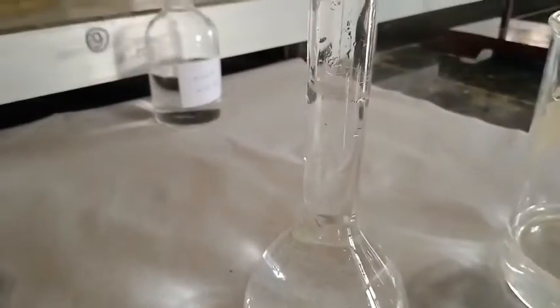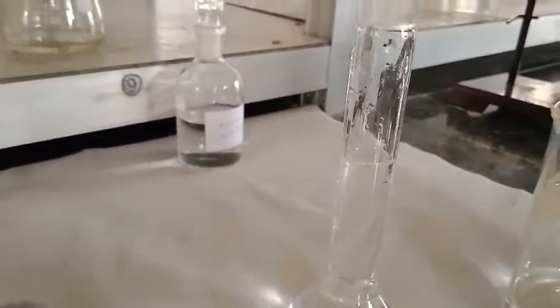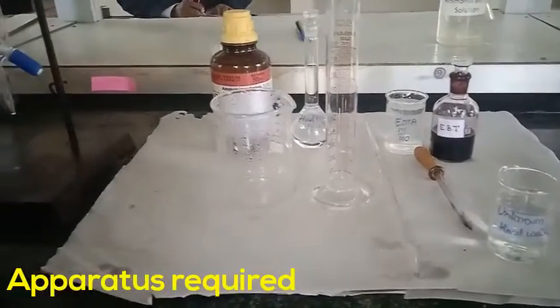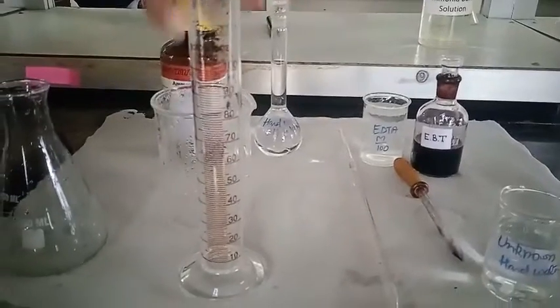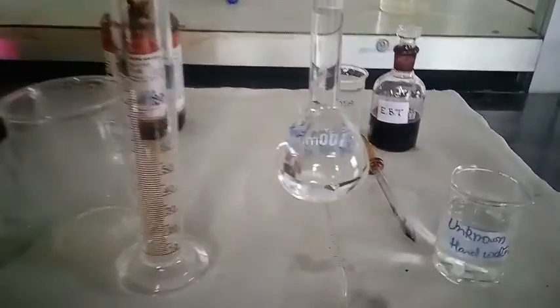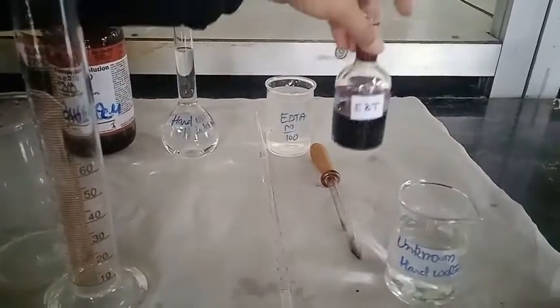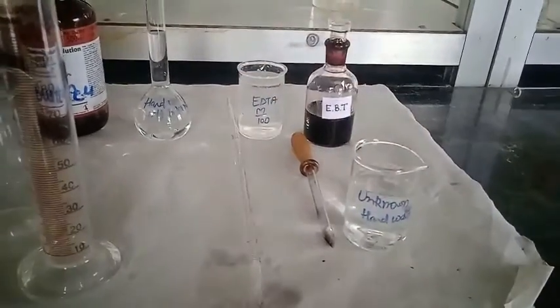Now I am going to dissolve it in a 100 mL measuring flask. You can see I have made it up to the 100 mL mark. Shake it well and then I am going to transfer this M/100 EDTA solution into the beaker. For standardization of EDTA, the apparatus we require are: measuring cylinder, beaker, conical flask, standard hard water, EDTA solution which we have prepared, EBT as an indicator, dropper, and unknown hard water.